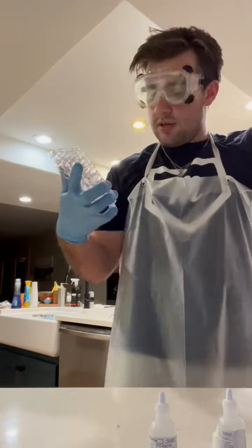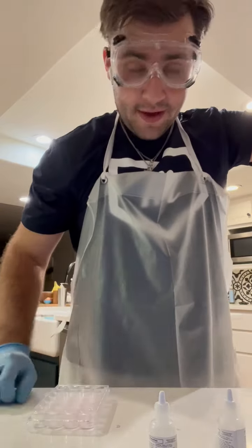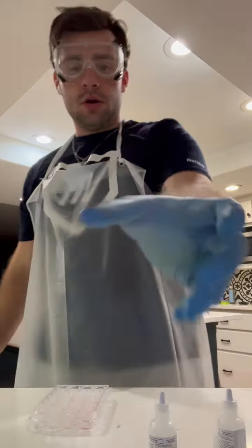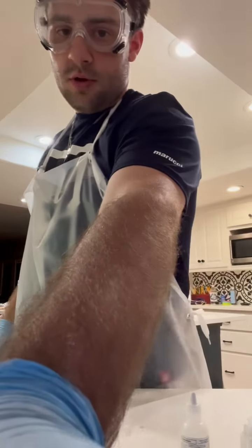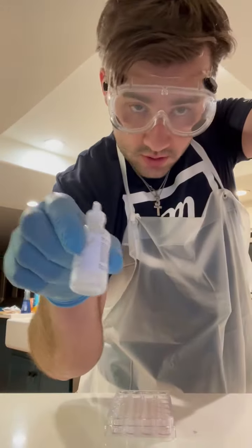I'll be back. Now that it has had time to dry and rinse multiple times, I'm going to do the 3rd one, which every time has 8 drops of potassium, 4 drops of starch, and of course 7 drops of this.